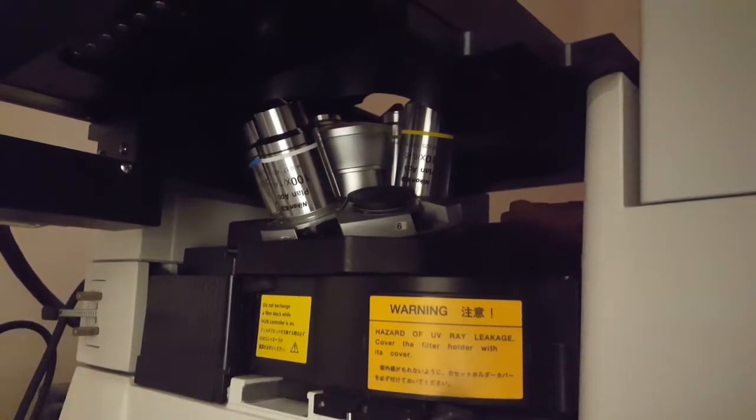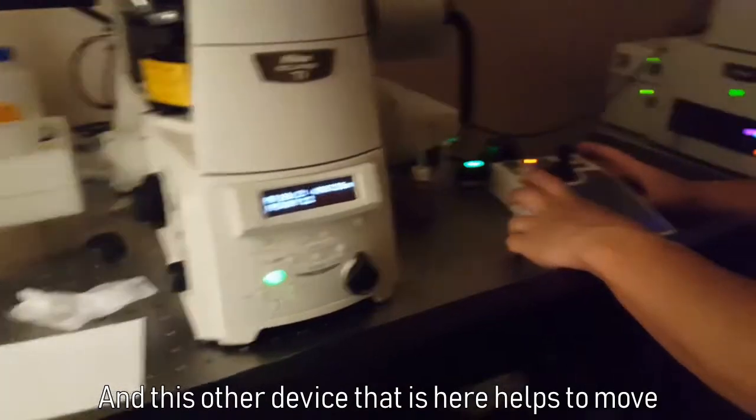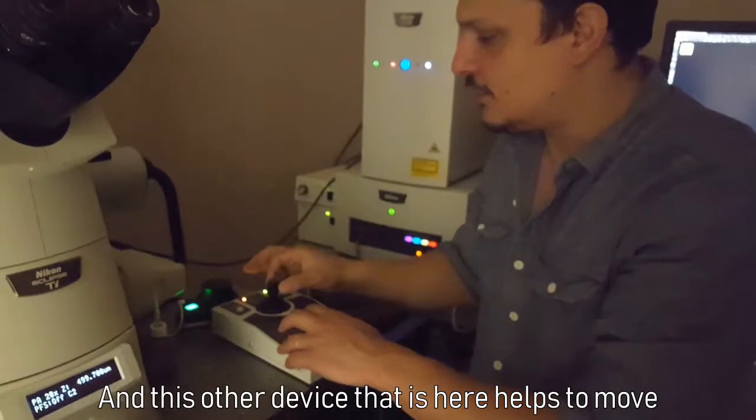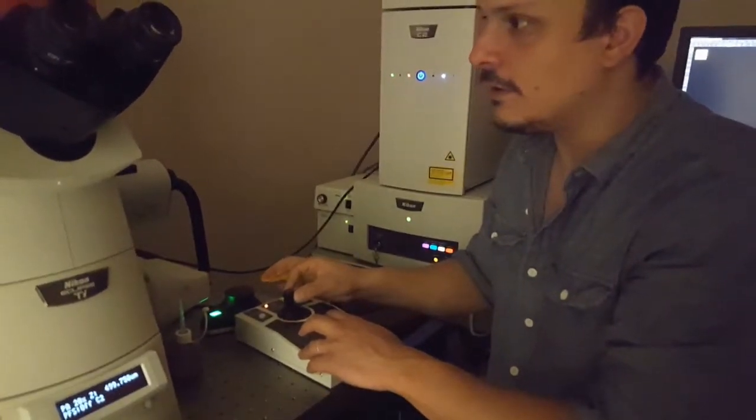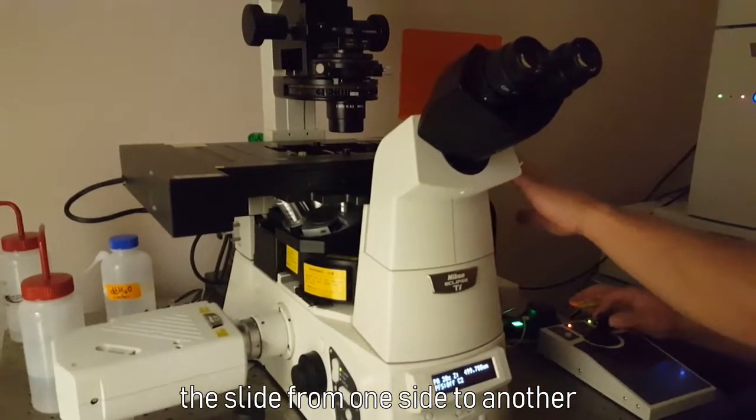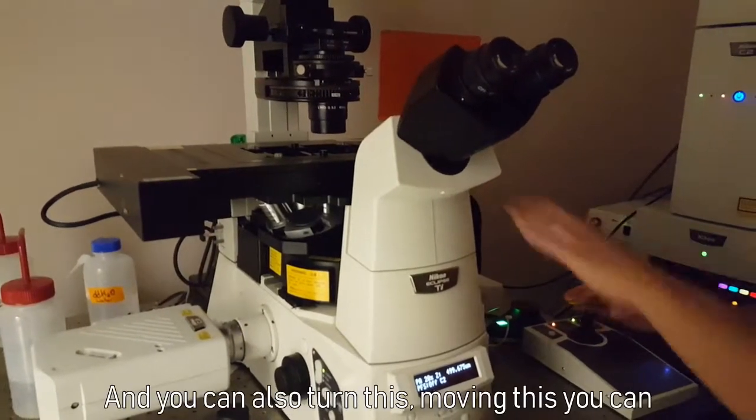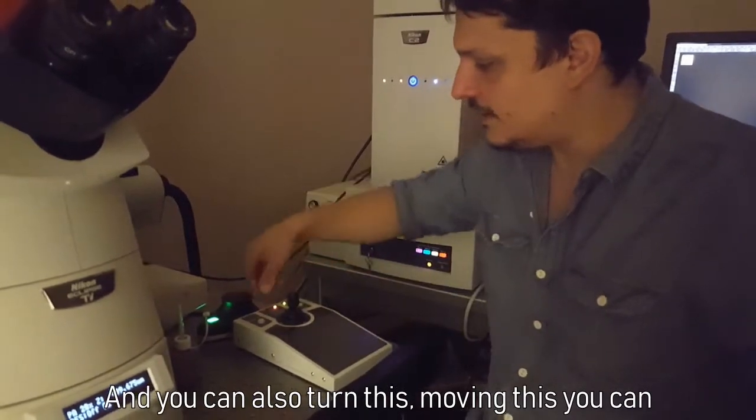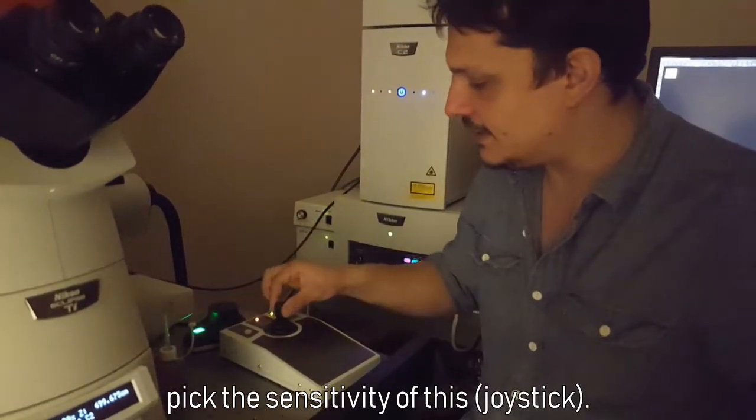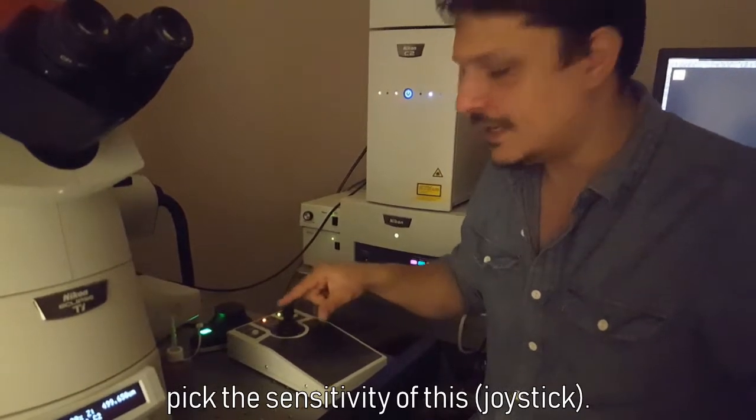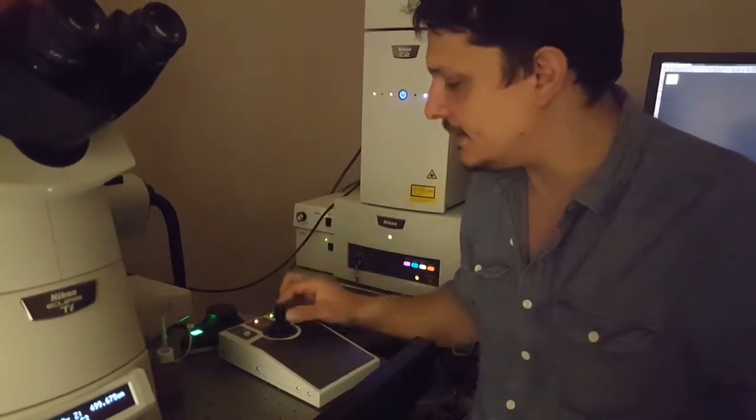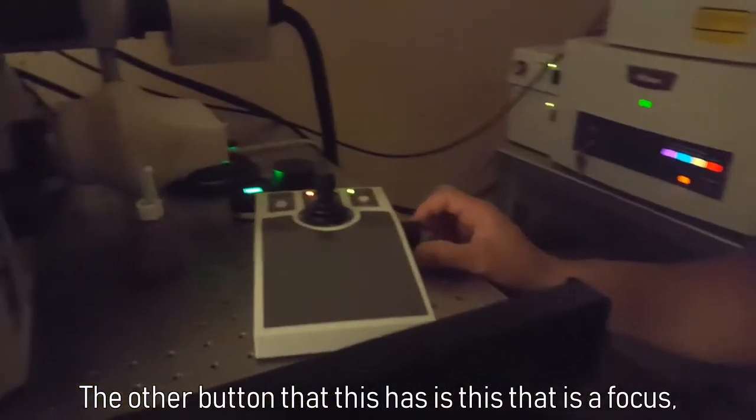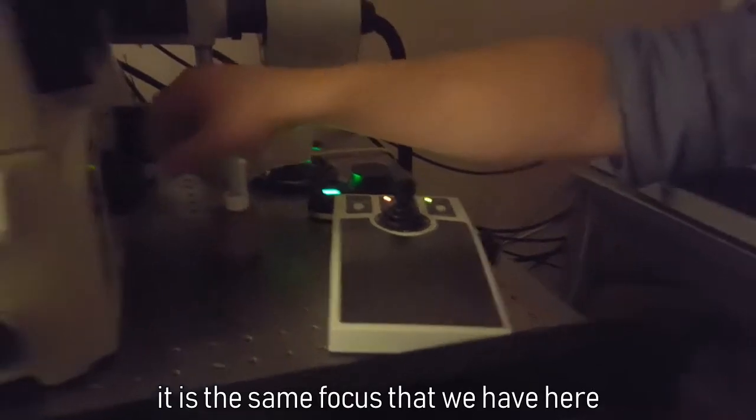And this other device that is here helps to move the slide from one side to another. And you can also, by turning this and moving this, pick the sensitivity of this joystick.